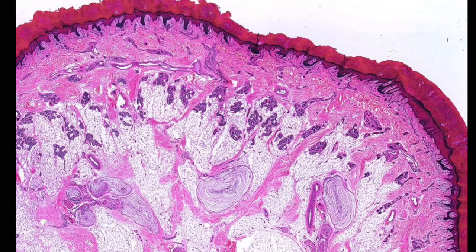So let's reorient. This is a much more macroscopic scale. We're looking at maybe 4x magnification of this slide. Up top, I'm just going to put an arrow towards it. This is going to be our epidermis. We still have our basement membrane, so don't get it twisted here. This is not our basement membrane. This underlying wavy pattern is going to be our basement membrane. And then everything else we see here is either dermis, put a D for dermis, or we have hypodermis. You can see this layer can be pretty thick depending on how much subcutaneous fat we have.